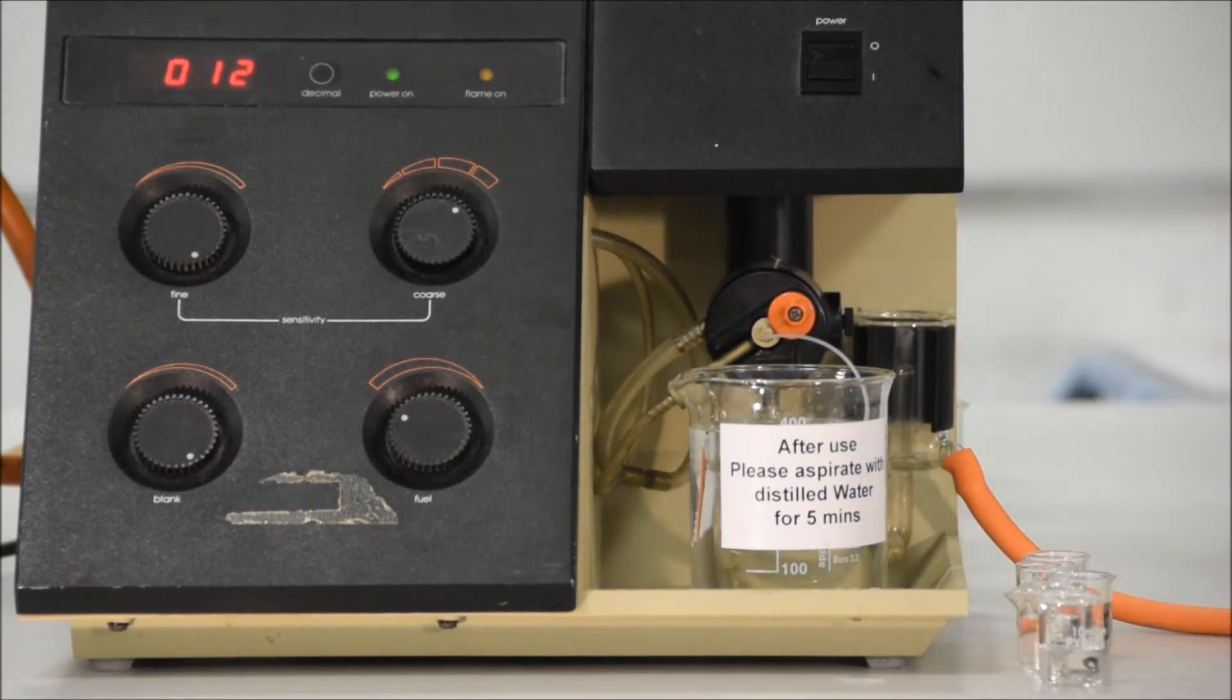You should then return the inlet to distilled water and allow it to aspirate for maybe 20 to 30 seconds to clear the machine until it returns to zero.